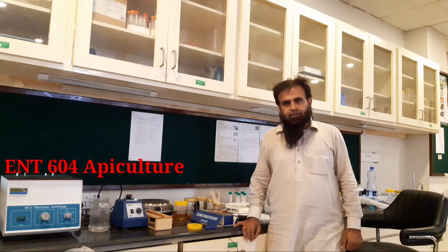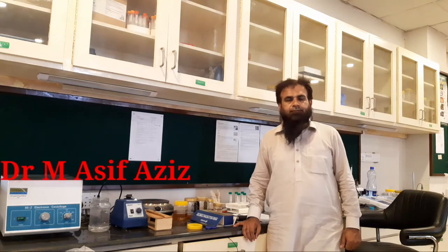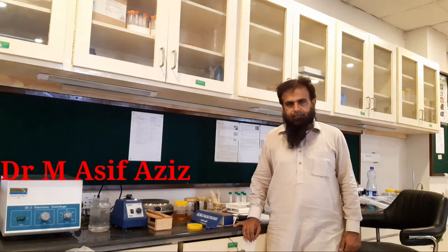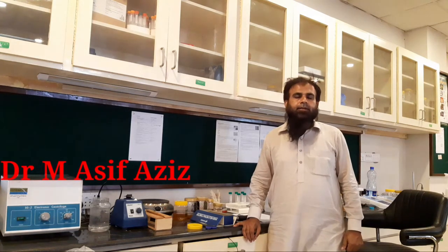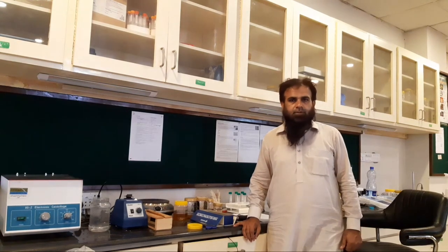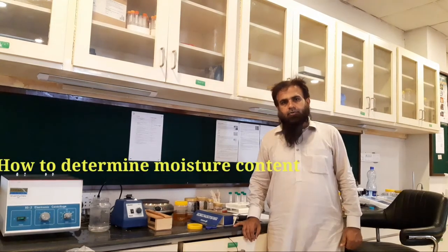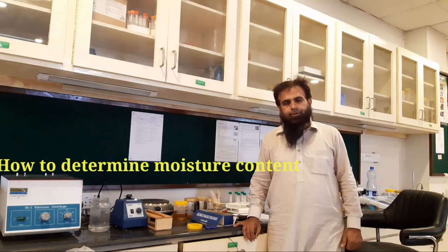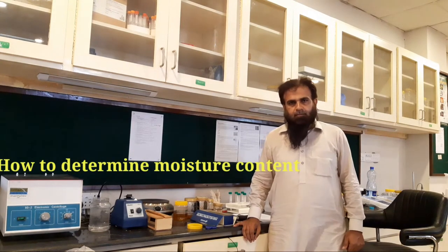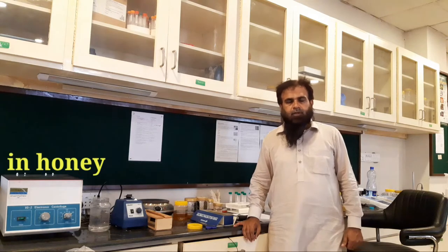Dear students, we are working in the Apiculture Farmer Training Lab, Pir Mehr Ali Shah Arid Agriculture University, Rawalpindi. Today we shall demonstrate how to determine the moisture content in honey.